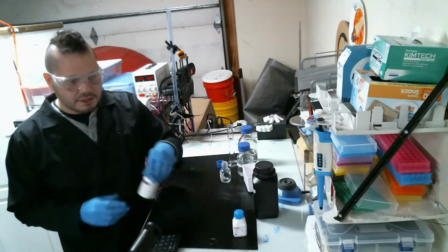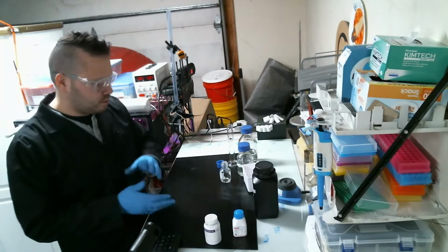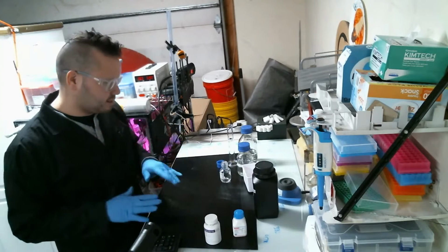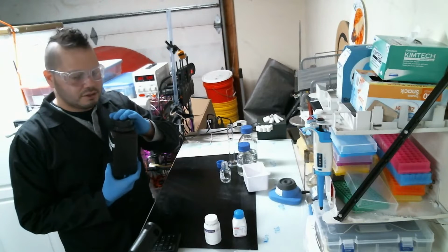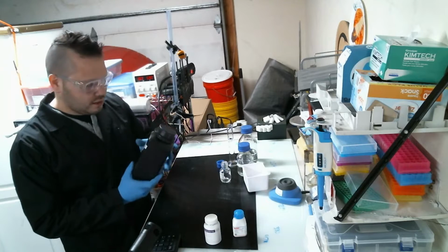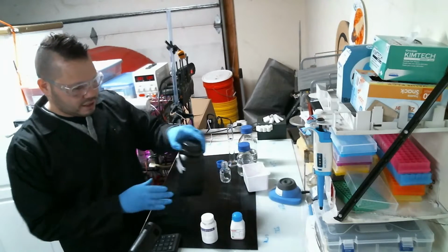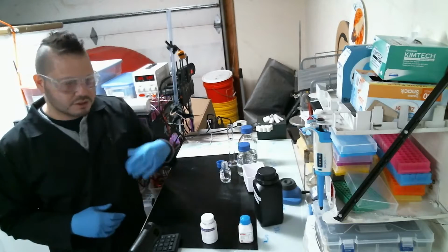Thing is, these aren't water soluble or anything. There's actually a process where you have to use sodium hydroxide to dissolve it, and it's a process. And there's vials in here, and I have them in here because they deteriorate with light, but there's vials in here with each of the hormones, and it comes out to about half a gram per 50 milliliters of solution.